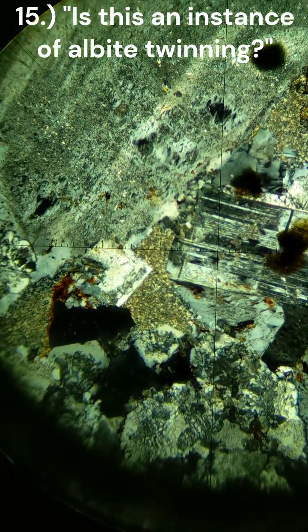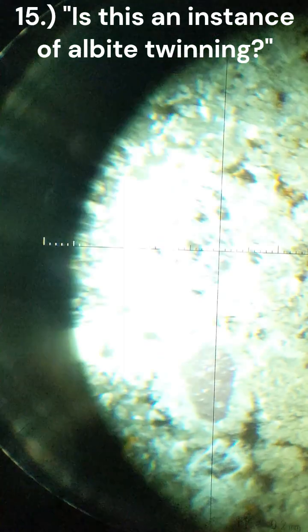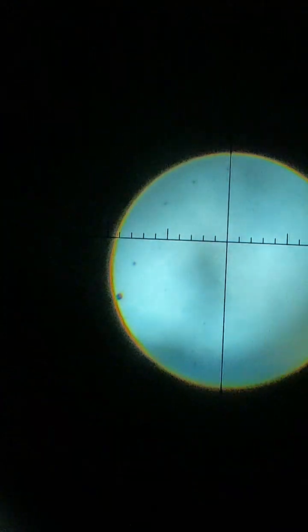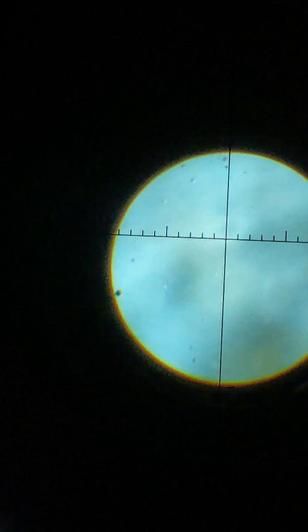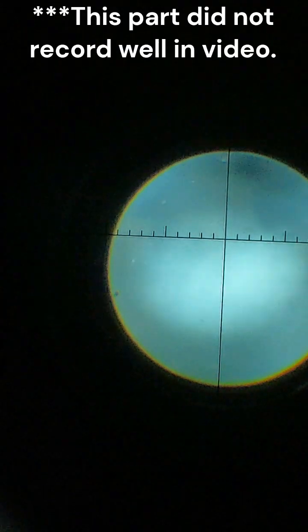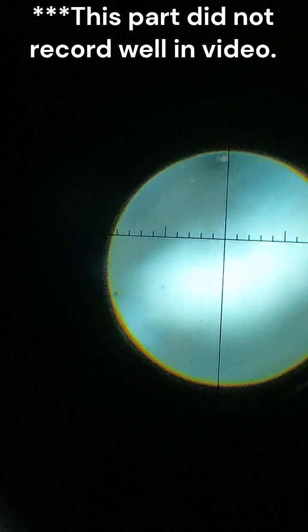Going more into it, going to go to 63 magnification and turn on Bertrand lens. See if I can actually get this to zoom in. It kind of actually looks like it is biaxial.